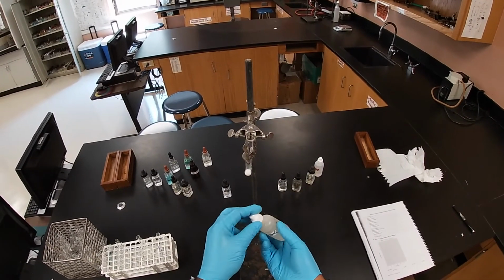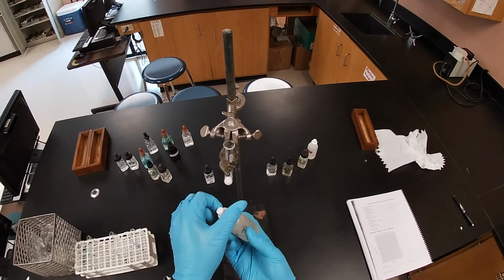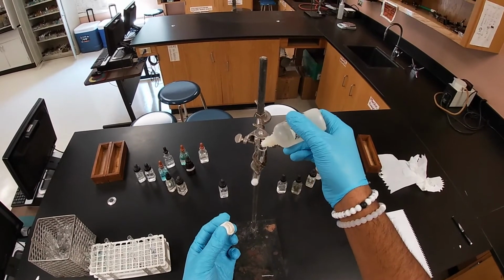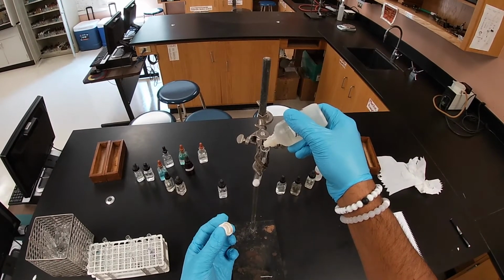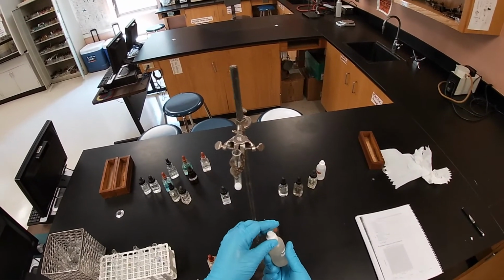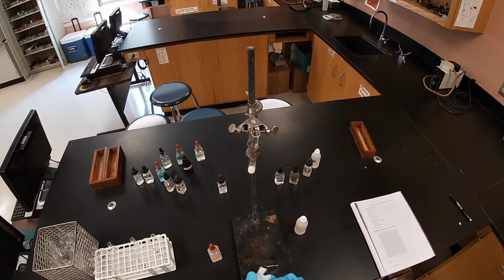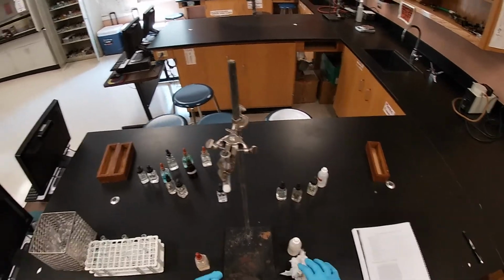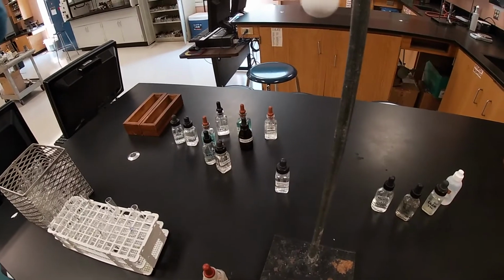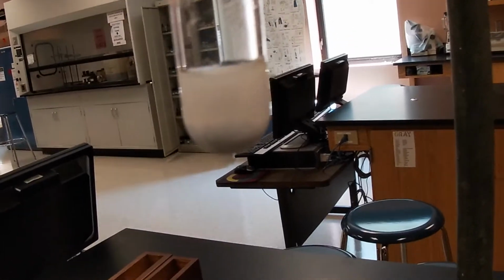And we do. I added 2 dropperfuls. We add another one. Okay, I added 2 more drops of the sulfuric acid. I thought I had heard some fizzing, but I didn't. We're going to end up with a murky substance, very, very white. I'm going to zoom it in for you all, maybe if it lets me. There you go. And so there you can see the contrast.